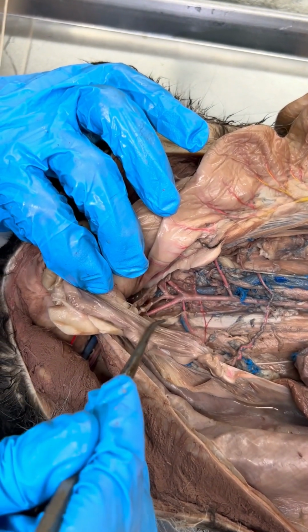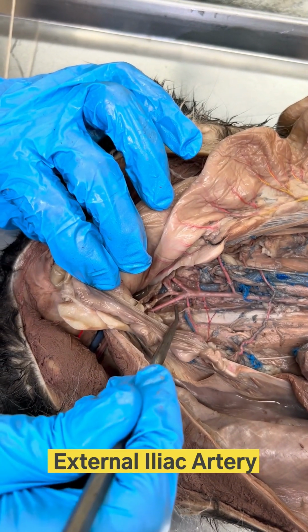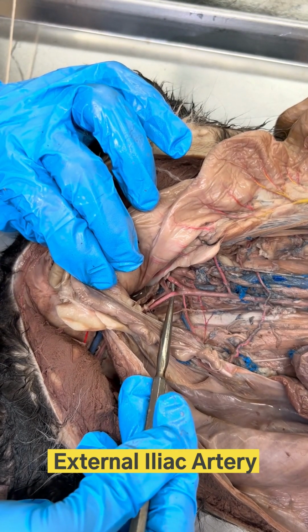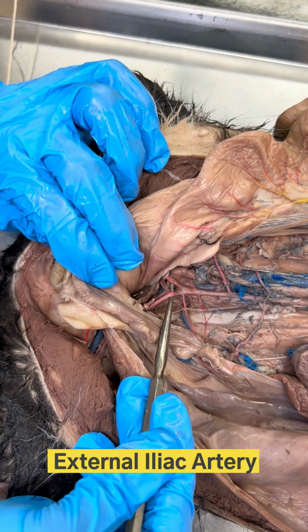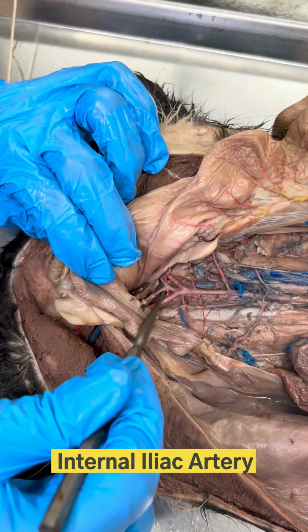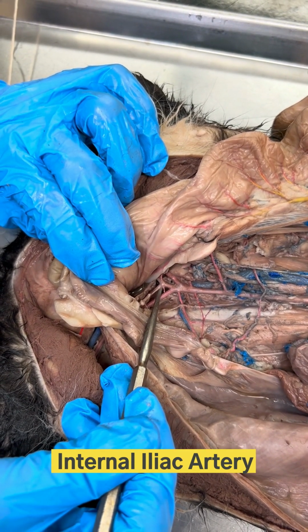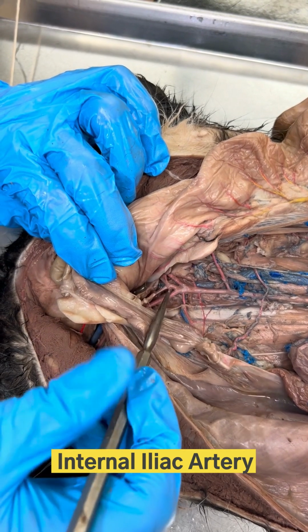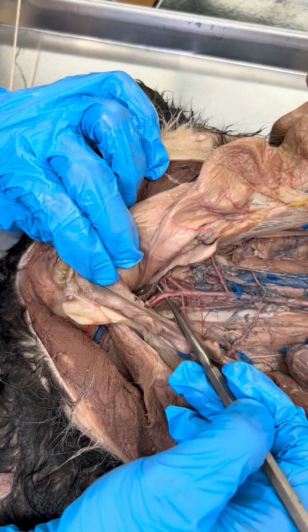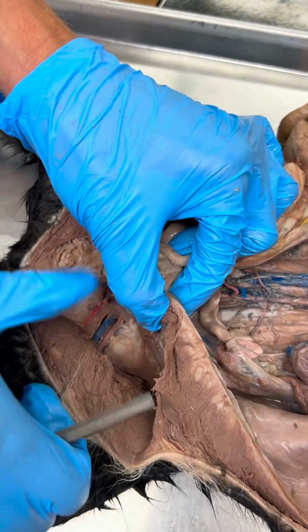Now, unlike humans who have common iliac arteries, cats do not. So therefore, the first branching pair of arteries that sit more laterally are the external iliac arteries. And just below them is what looks like another forking pair of vessels. Those would then be the internal iliac arteries. It is one of these external iliac arteries that will puncture its way through the body wall and enter the thigh.